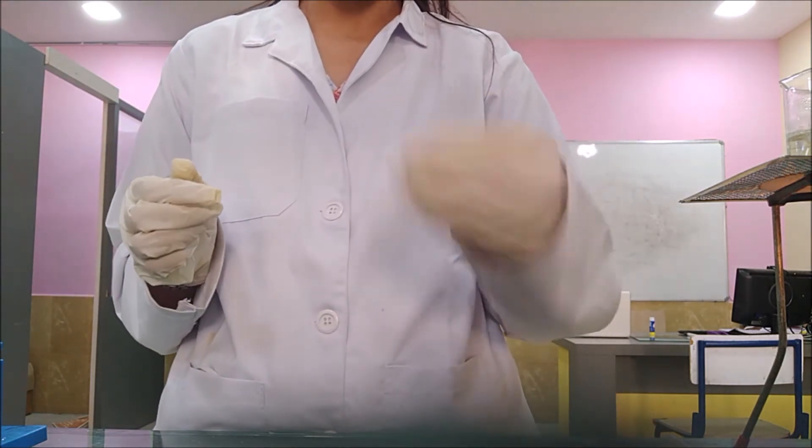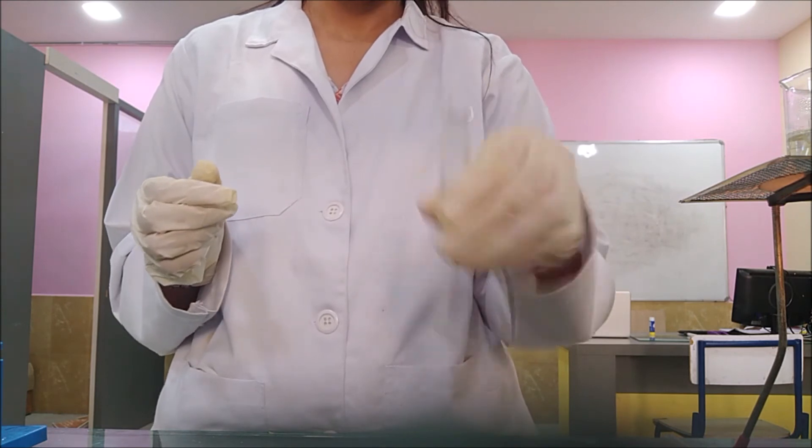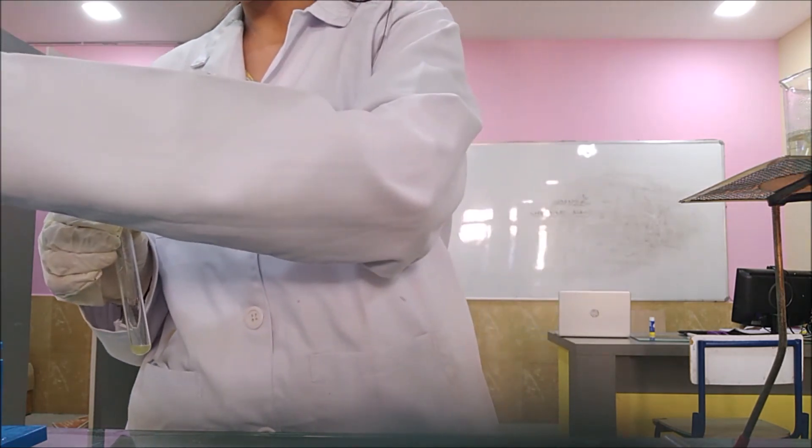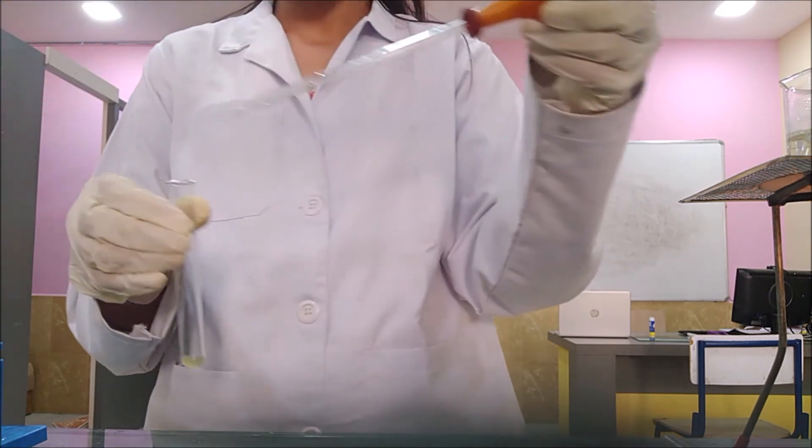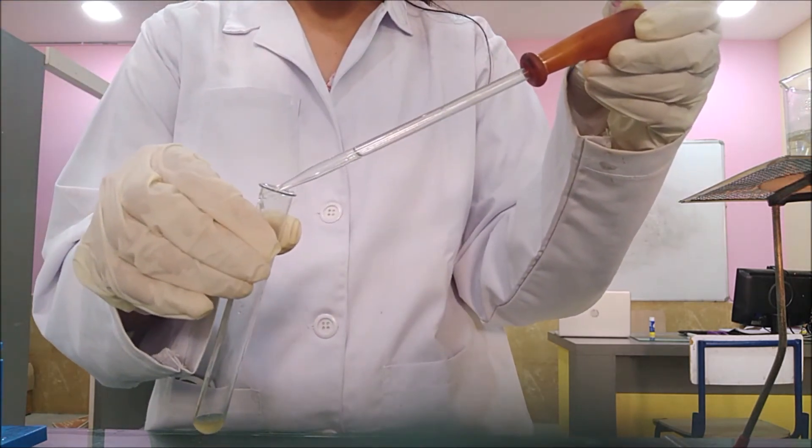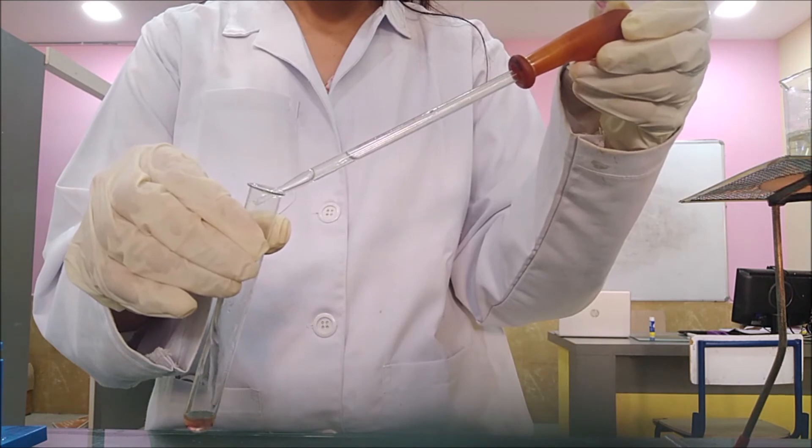Shake it well. Then add around 2-3 drops of NaOH (Sodium Hydroxide).